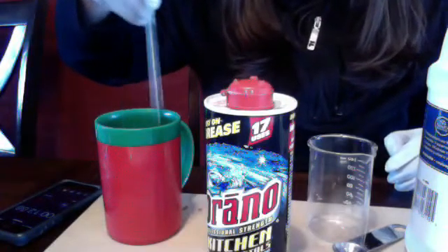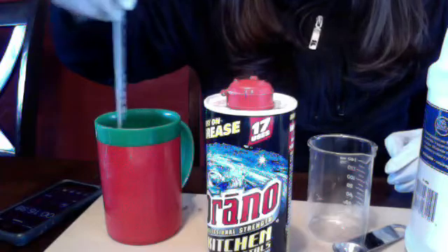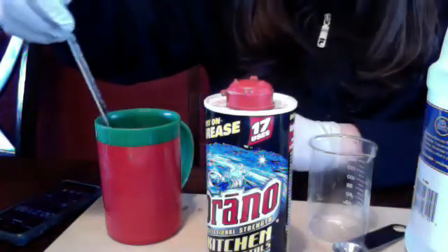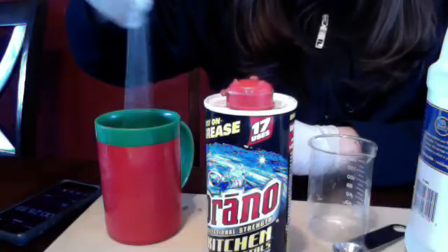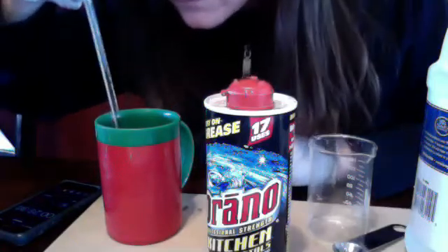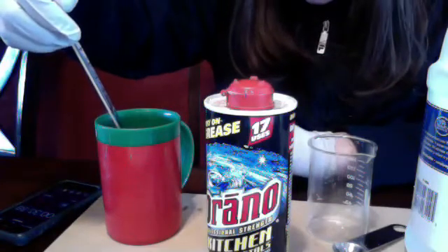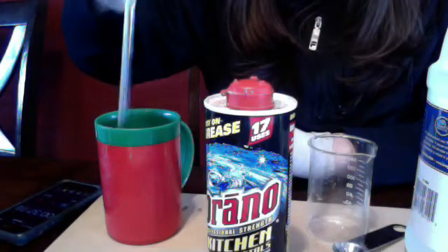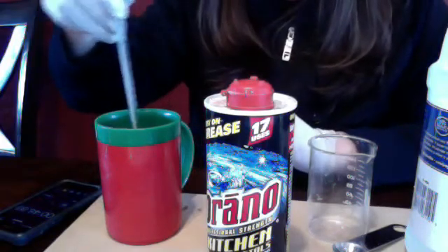You can see this exciting stirring motion. Every 30 seconds we are going to get a reading, and after two consecutive 30-second rounds at the same temperature we will assume that our experiment is at its endpoint. Okay, we're at our first 30 seconds — we're at 20 degrees Celsius. You could probably already tell right now if your hypothesis was correct. This is creating heat as a product, which makes it exothermic, which means our enthalpy will be negative.